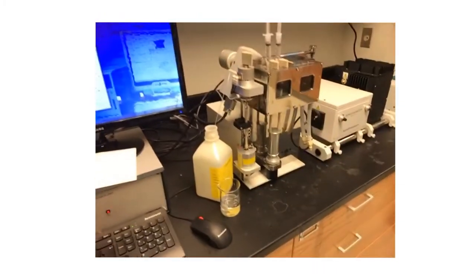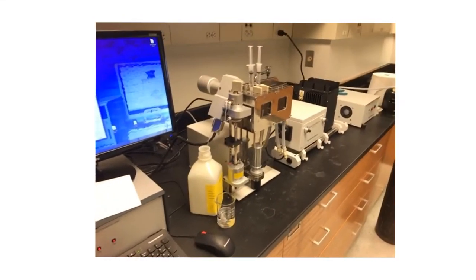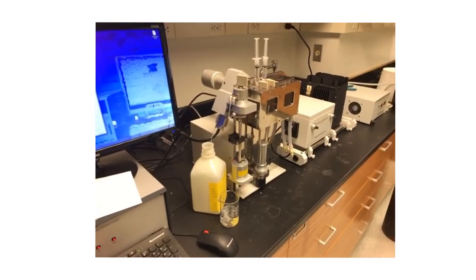Okay, so at this point, we'd be ready to go with the experiment. I think that's probably good enough for this video. So I'm going to go ahead and hit stop and make a second video later.